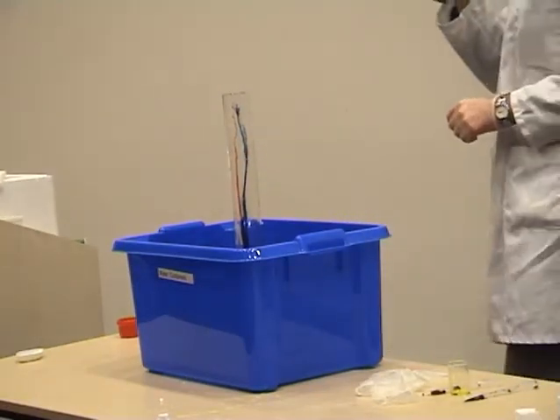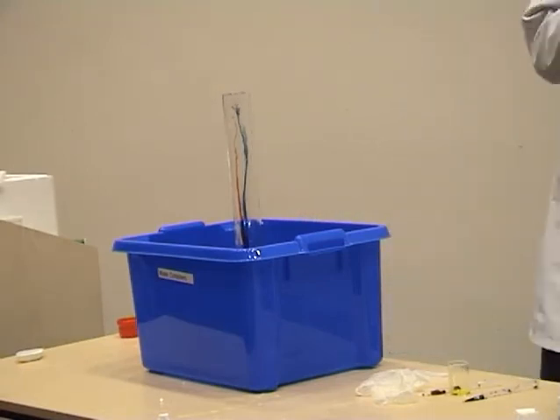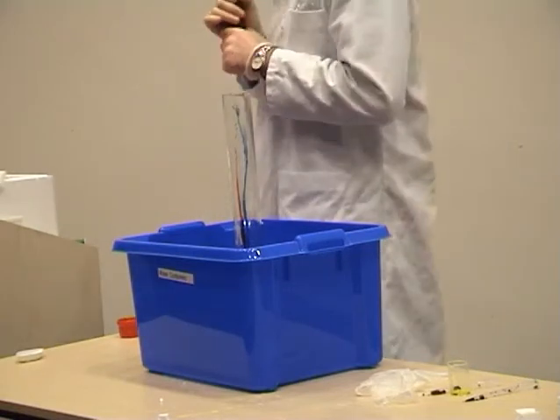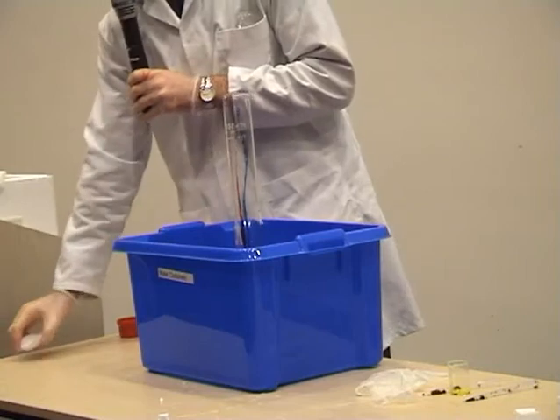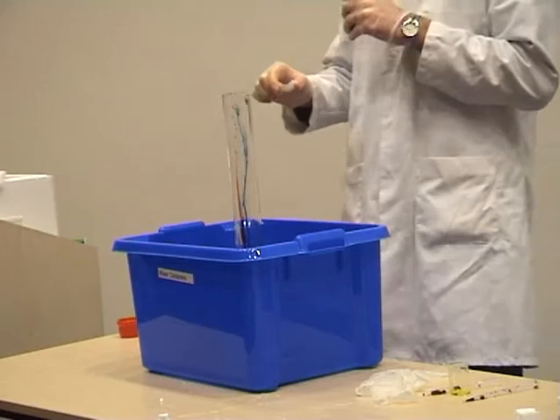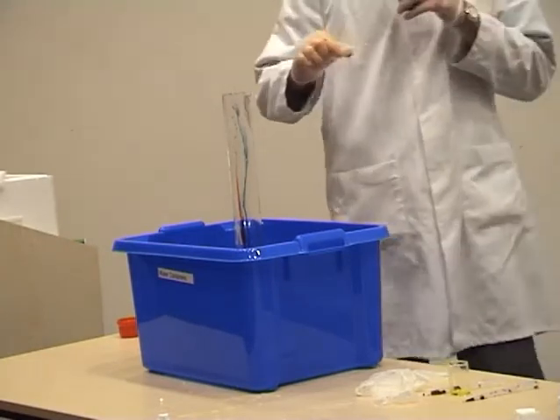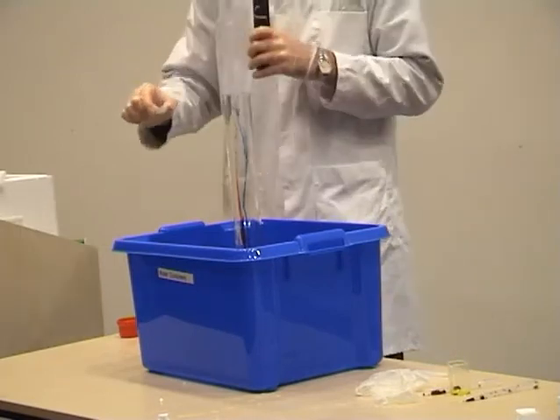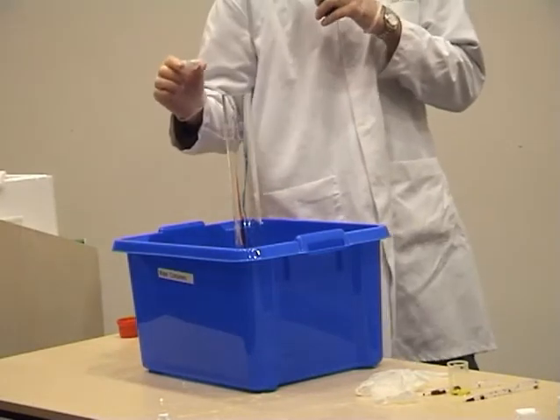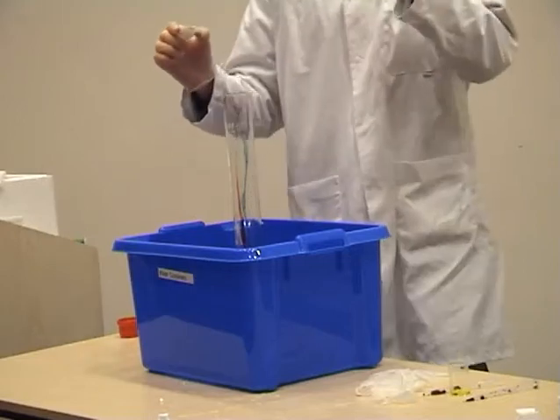Okay guys, are we ready? John, you ready? Colin, you ready? Right, we're going to release some oxygen here, as I said before. To do that, we're going to add a chemical called potassium iodide, and hope for the best. I think we need a countdown before we start. Can you guys give me a countdown? Okay, are you ready? 5, 4, 3, 2, 1. Hold it, hold it.